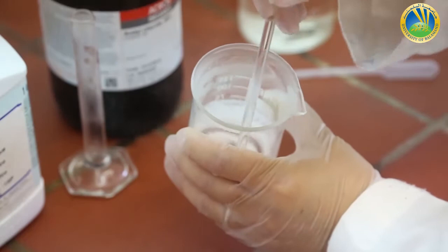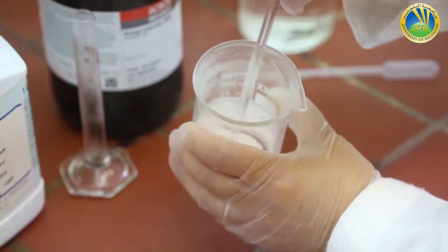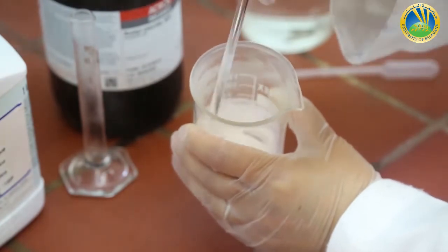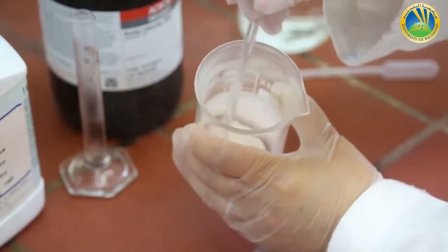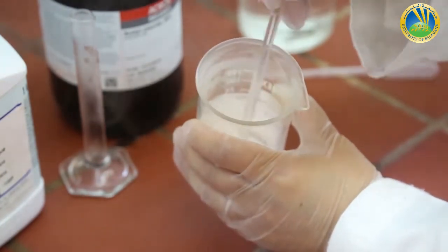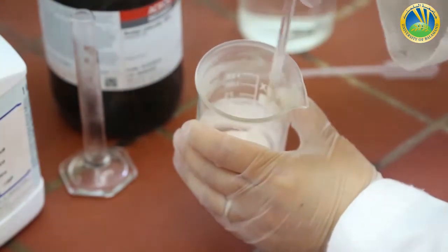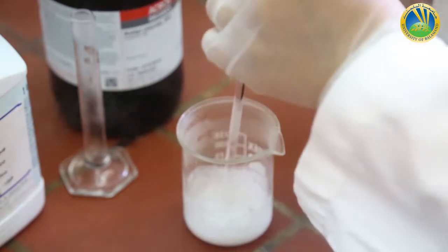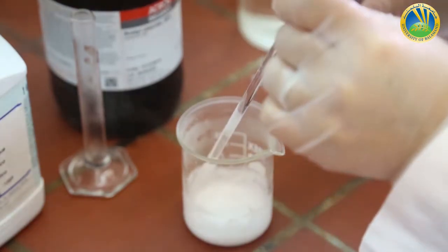Now I have to stop this reaction by adding 50 milliliters of cold water to have the aspirin granules in suspension ready for Buchner filtration.